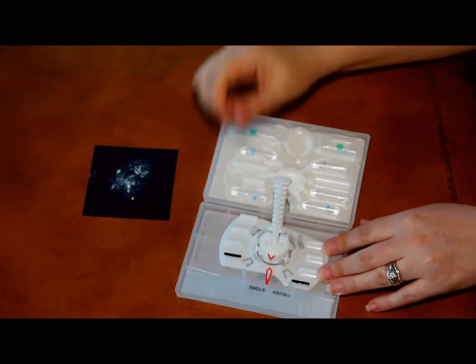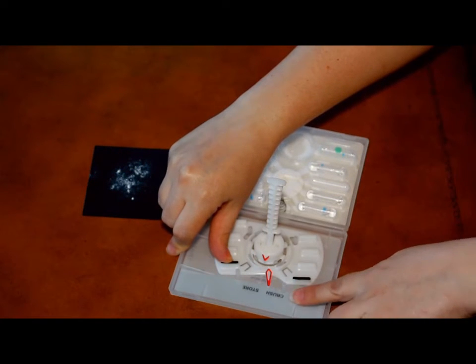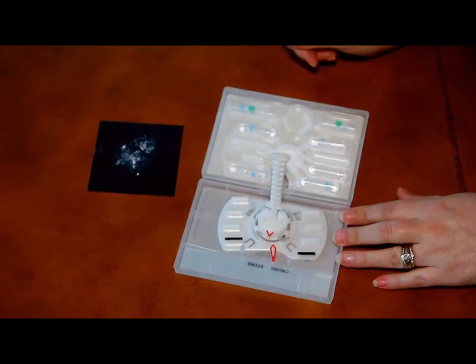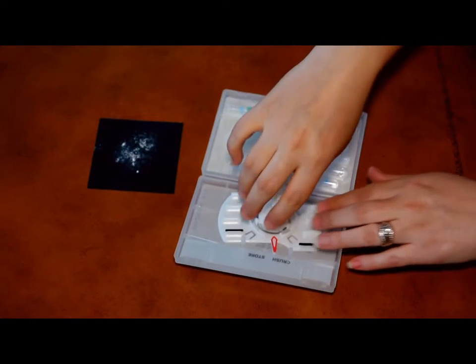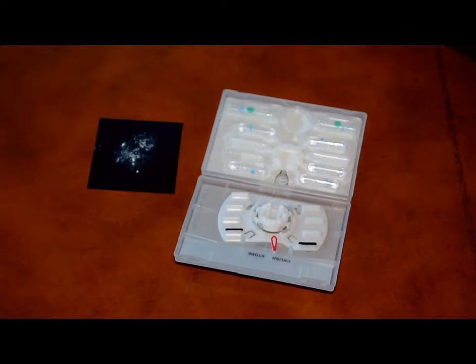Release the handle and push the black rib on the crusher to rotate the crusher from store to crush. Pull the handle sideways and remove the handle with the cover. Place the handle and cover in the plastic storage bag for disposal.